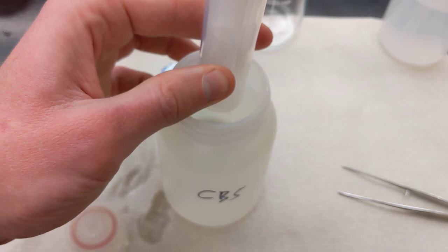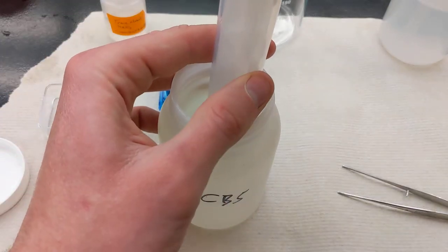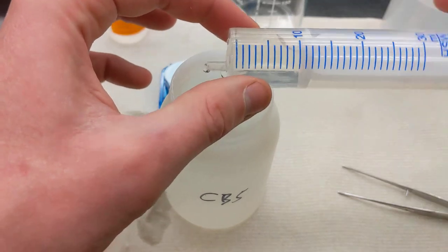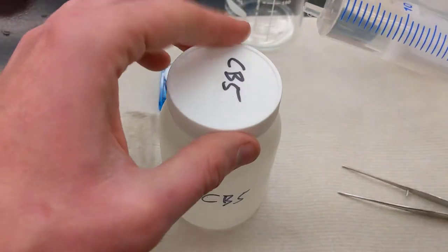I'm going to dip just the tip of this into the bottom here, and I'm going to draw up about 5 or 8 mils. This is maybe 10. I don't need quite that much, but this will be fine.